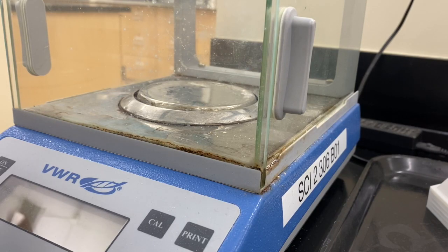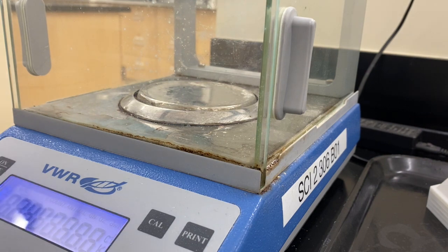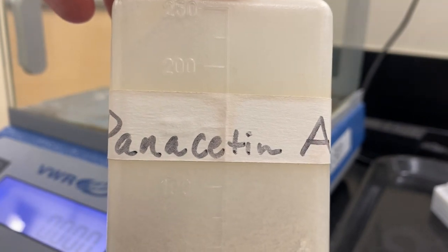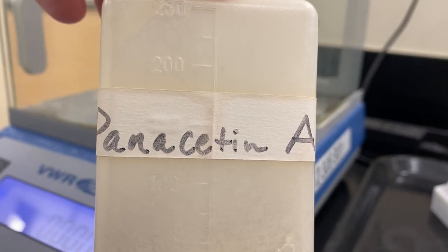The first thing we need to do for this lab is weigh out our mixture. Panacetin A will be the mixture that we use to do this demonstration.